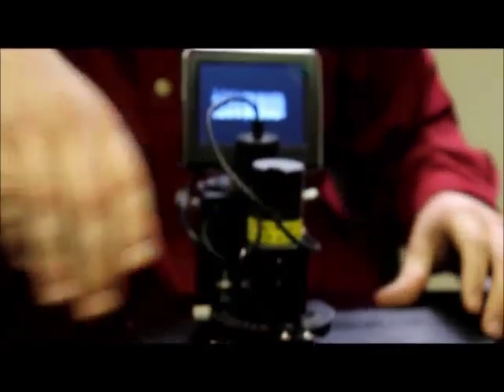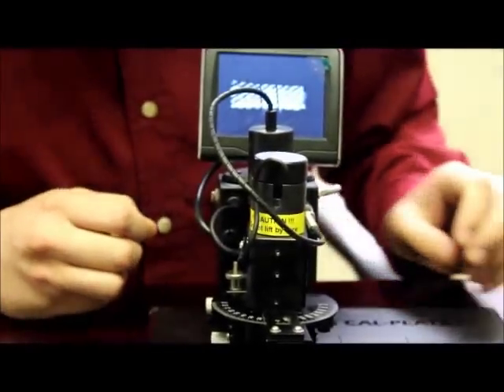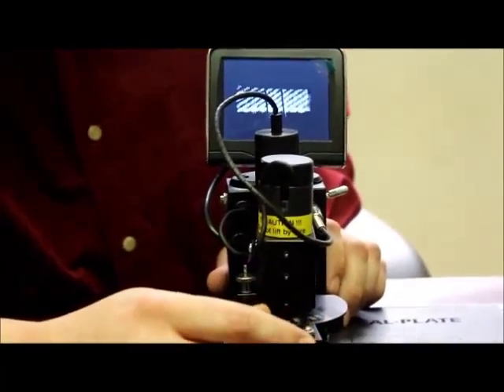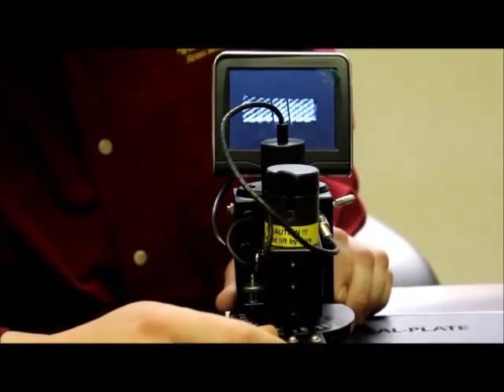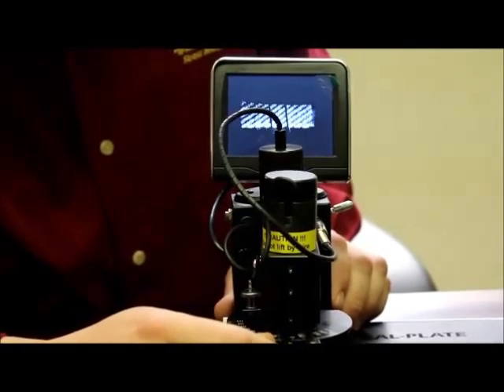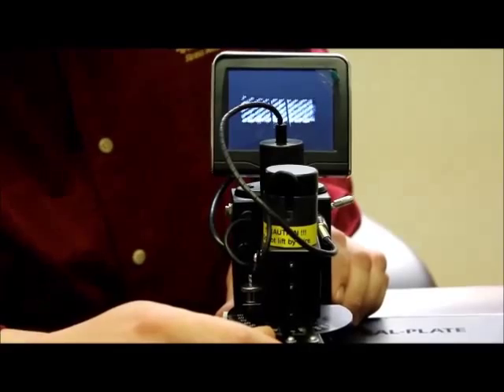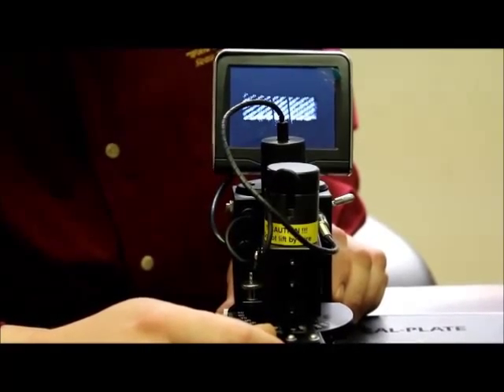Every GASP instrument should come to you in a way where it is prepared to measure on the cal plate immediately once you receive it. However, there are some small adjustments that will need to be made once you move to your samples of glass that you'd like to measure.